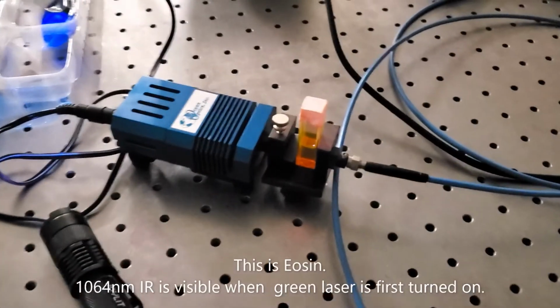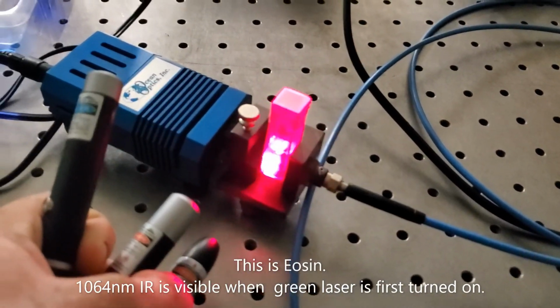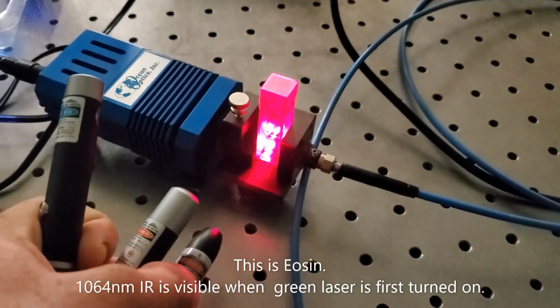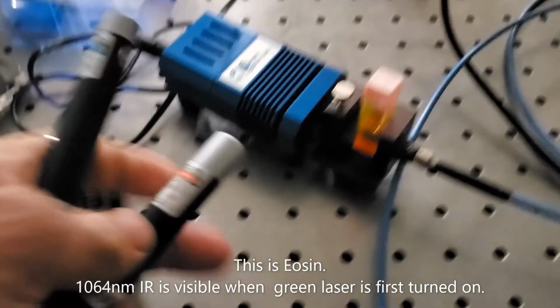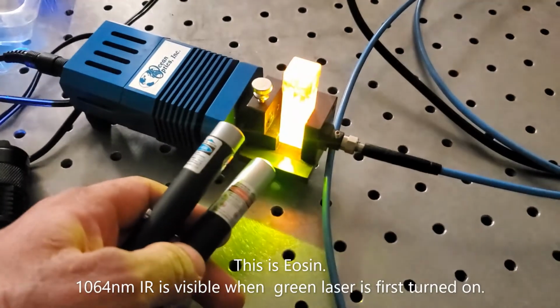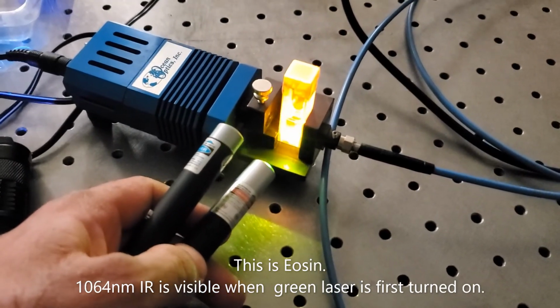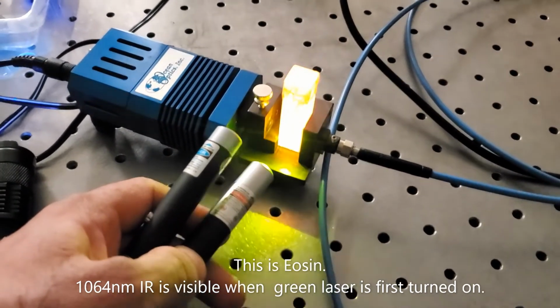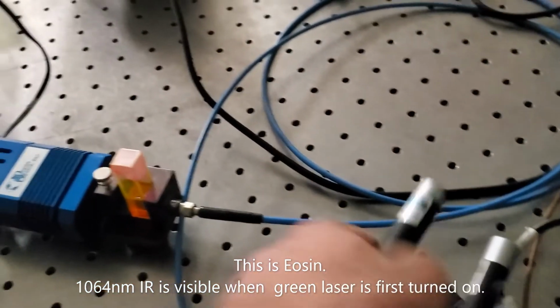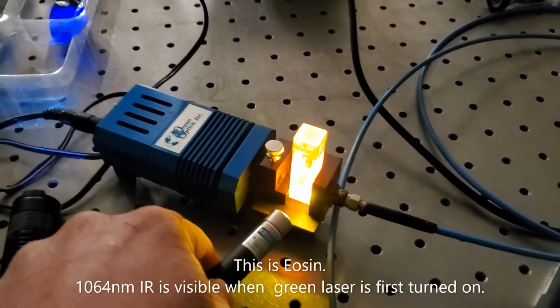So this is the eosin Y, and I'm going to illuminate it with the red laser, and what we can see is a lot of scattering, but this is the same wavelength that's going in, so this is not fluorescence. And here we go with the green, and I believe this is fluorescing. It's fluorescing yellow, and the violet is of course going to cause stronger fluorescence.